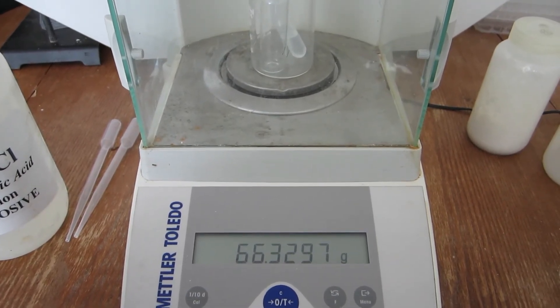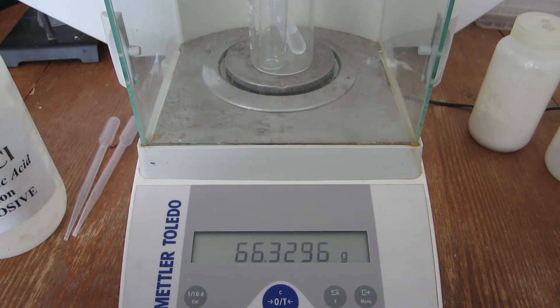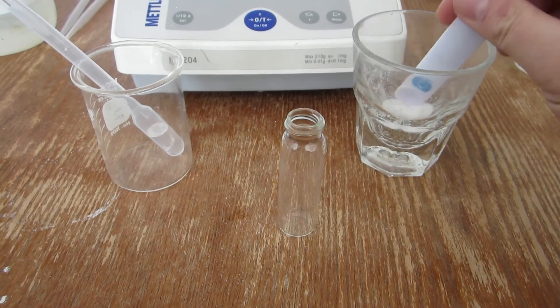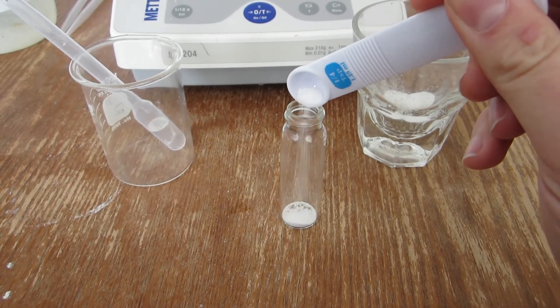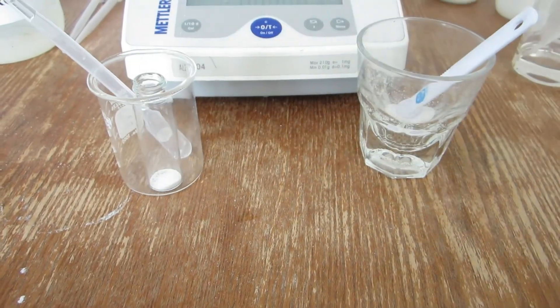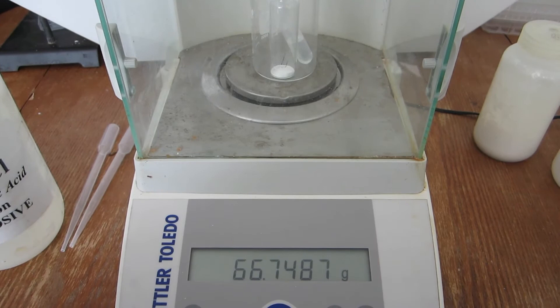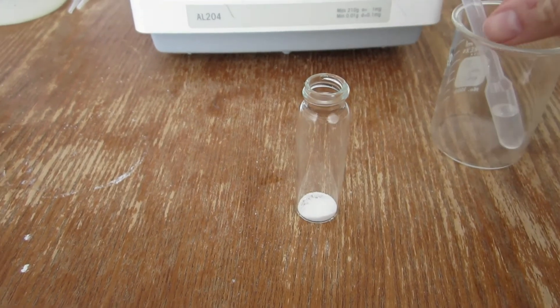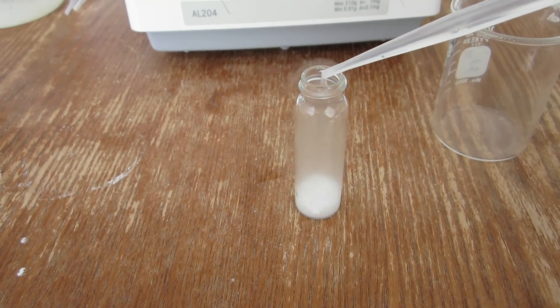For the third and final trial, the starting mass of the empty vial, acid, and beaker is displayed. As with the other samples, a small amount of the carbonate sample is added to the vial. The mass before the reaction can be recorded and is displayed. The acid is then slowly added to the carbonate sample, allowing the carbon dioxide gas to escape.